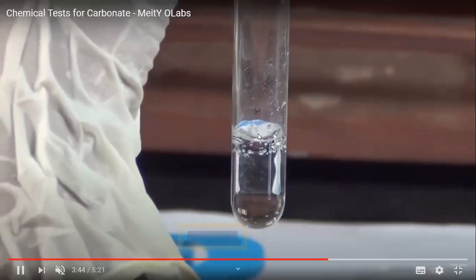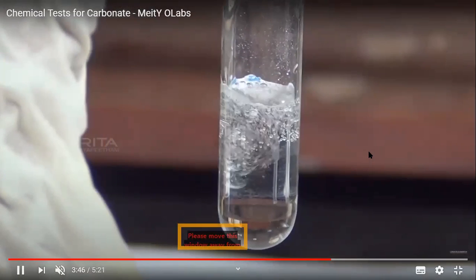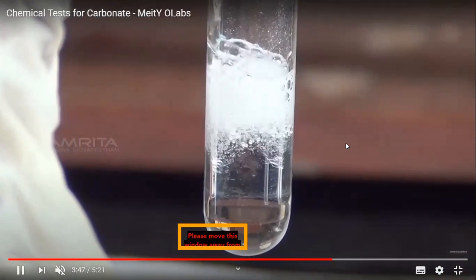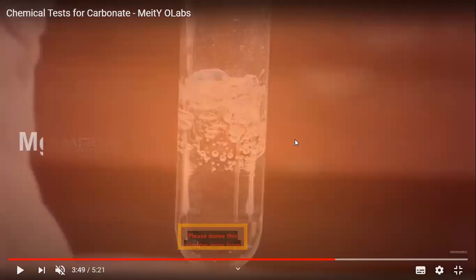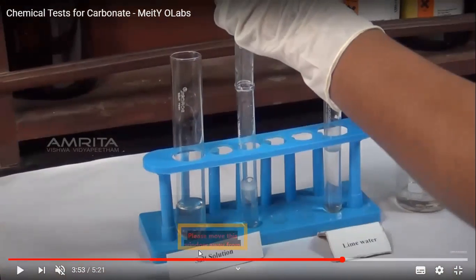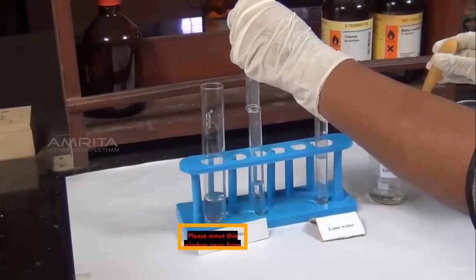When we add dilute hydrochloric acid, you can see that effervescences are produced. You can see it well. These are the various bubbles which are produced, which are the bubbles of a gas. These are the brisk effervescences that you can see here. Let us have a look at it once again. These brisk effervescences give us the presence of carbon dioxide gas. Any carbonate, when it reacts with HCl, produces carbon dioxide gas, and this is how we understand the presence of carbon dioxide gas.